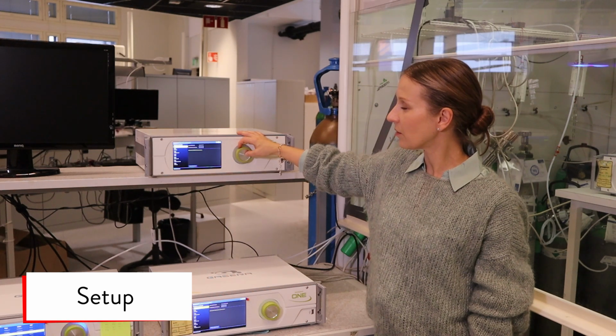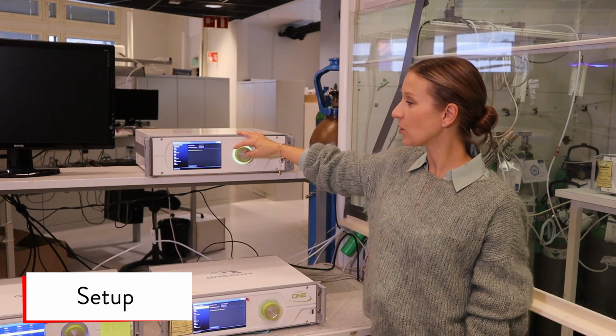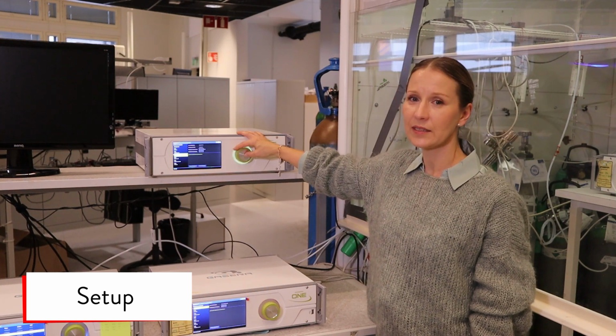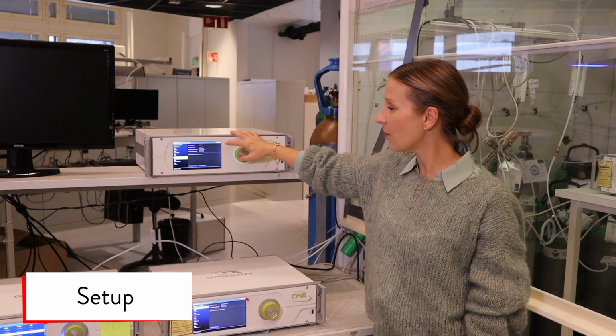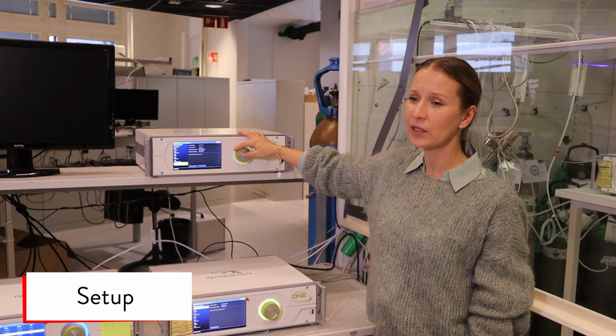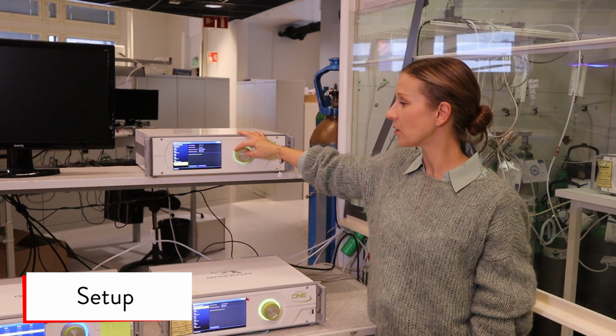From the calibration, you can calibrate components starting from background and every component as individual. You can set the sample concentration in ppms, and after 10 points you can accept the calibration.